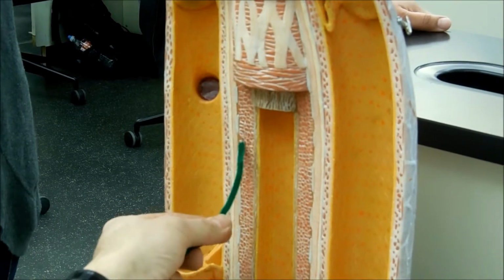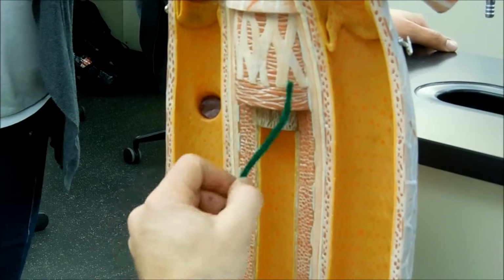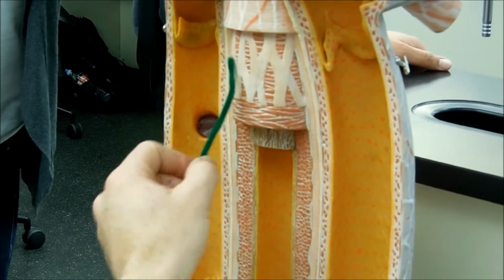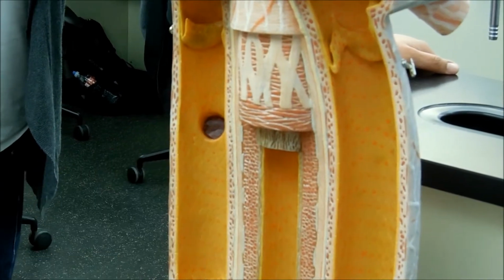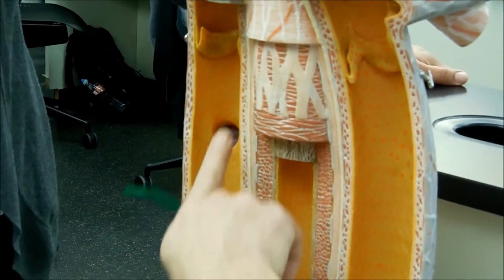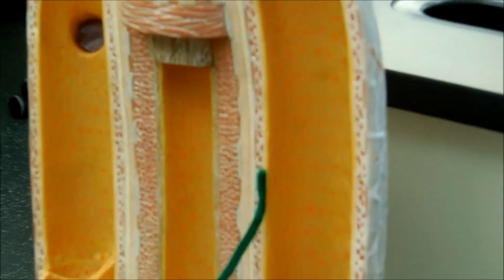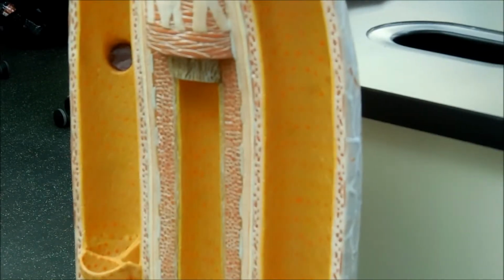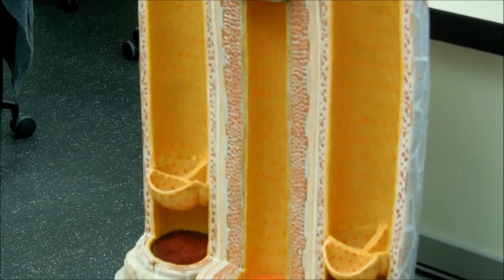The red is going to be the smooth muscle of the tunica media, because that's the meat of the vessel, which you can see here. And then out here is going to be the tunica externa. That would be the areolar and fibrous tissue of the tunica externa. And this would be the same thing for the vein, but thinner. So my intima is about the same, but my media is a lot thinner. And there's my adventitia, or externa. And then I have my valves. That's basically all you've got to know on that one.